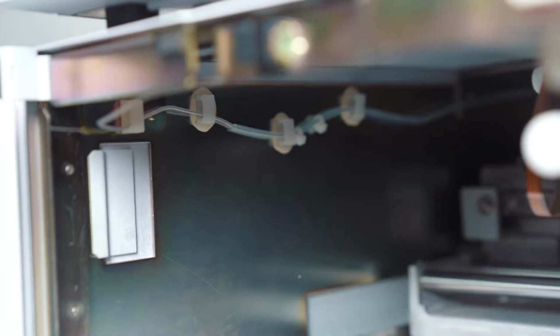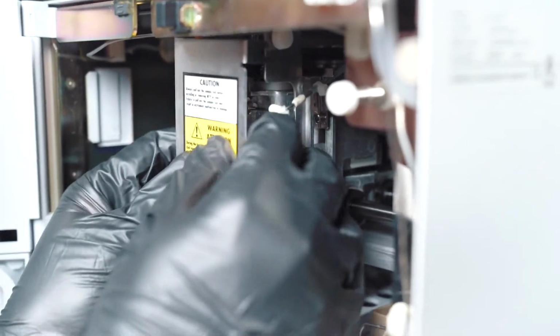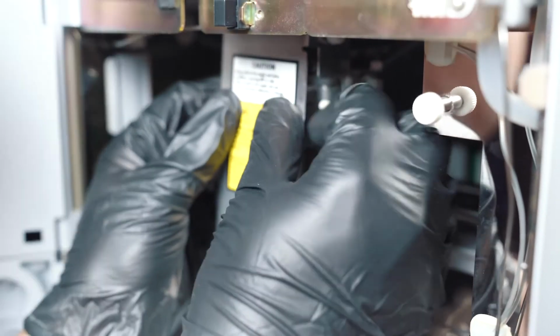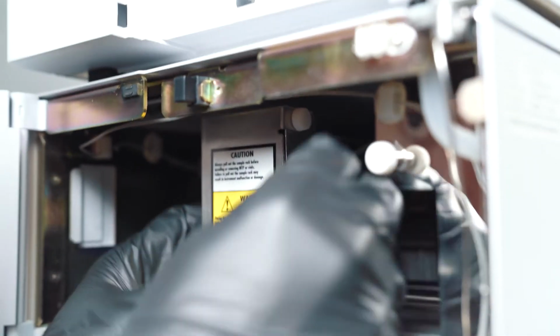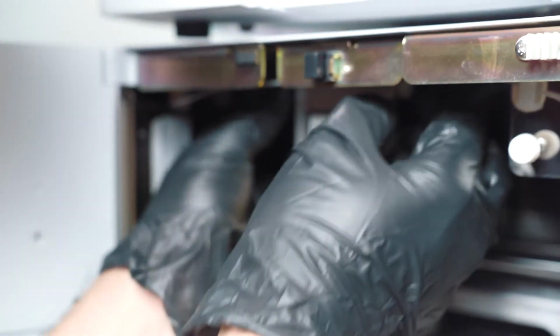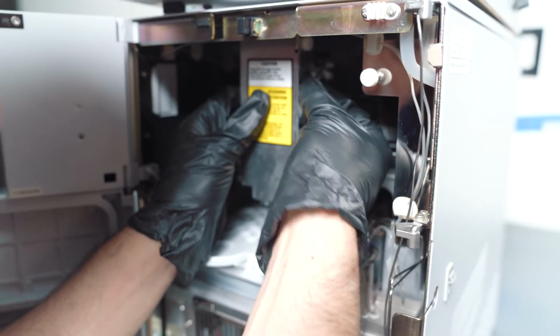Straighten everything out. And lastly, you want to put the door back on. This guy goes over the front face. See, that's why you don't take off the thumb screws, so you can just hook things back on and then tighten. 1, 2, and 3. All right, you've just successfully changed the loop. We did it.